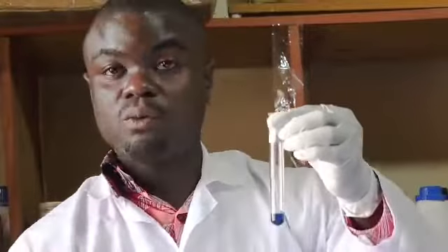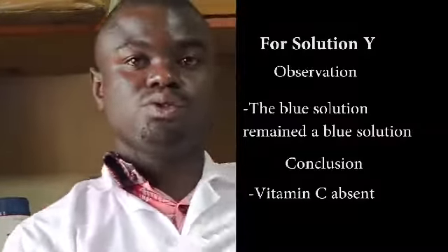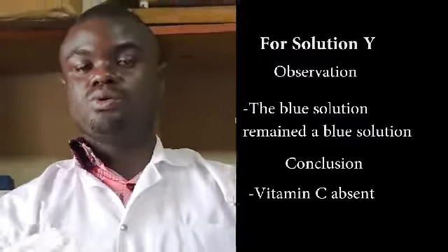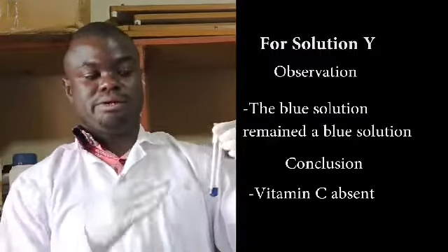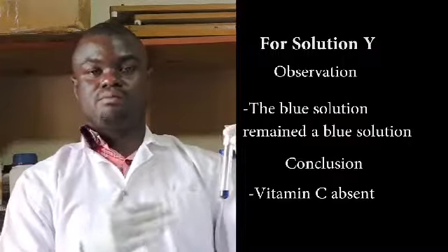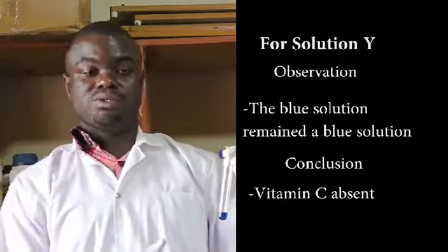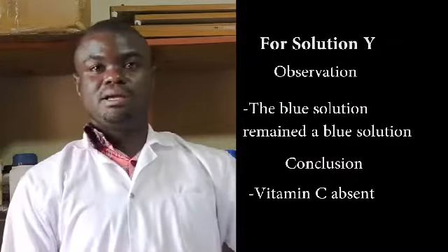Therefore, in my observation, I am going to say the blue solution remained a blue solution. And the conclusion is vitamin C absent.